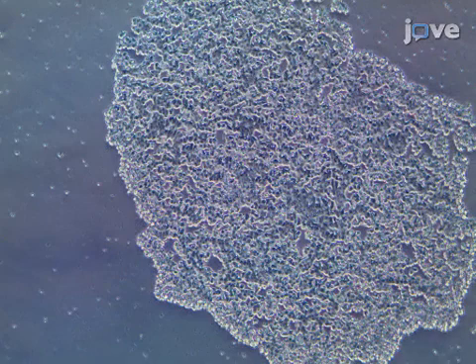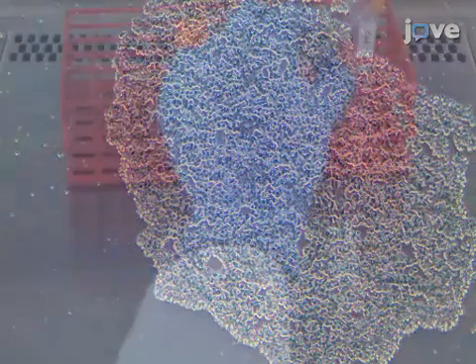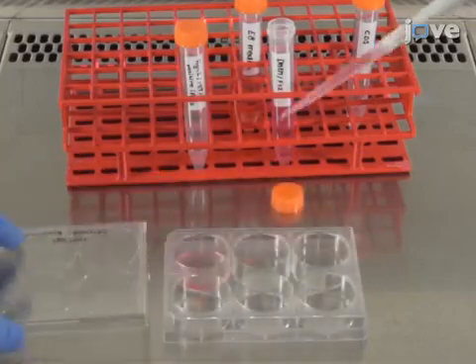Under the microscope, check whether the cells are detaching from one another. Then add 2 milliliters of DMEMF12 in the well.